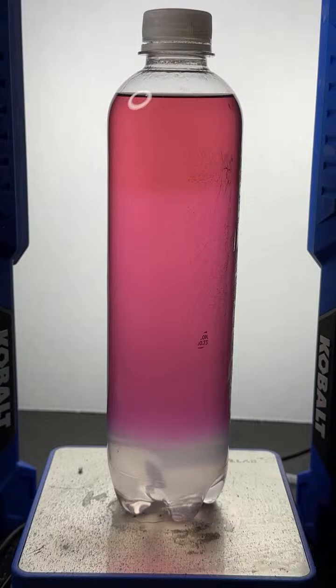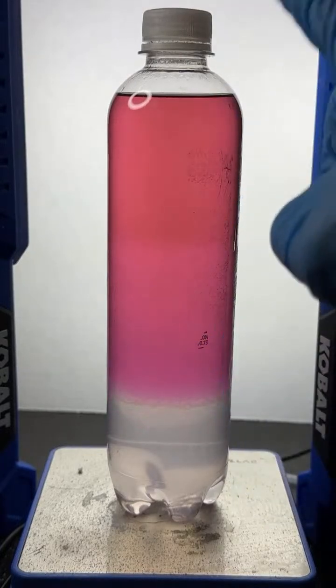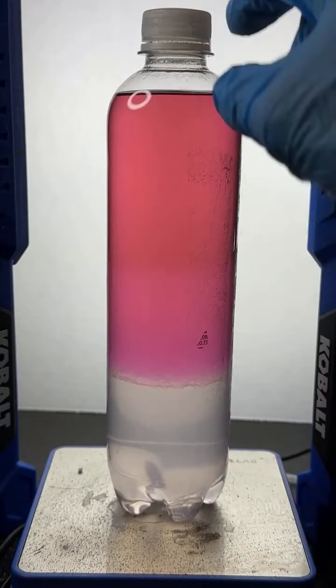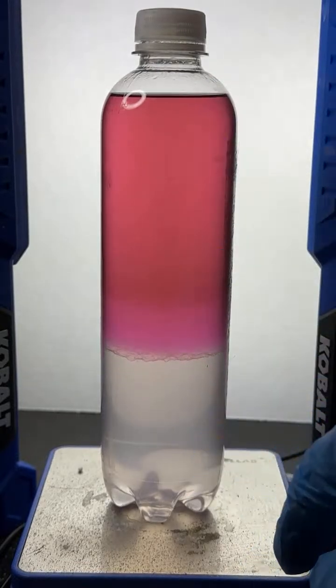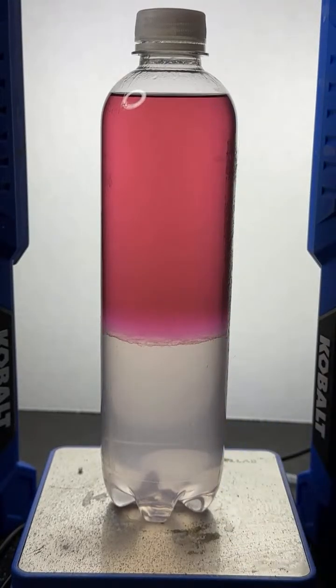Hey, thanks there, Nick. So, Nick, just to give you an idea of what we're doing, this is just a bottle that contains salt water. It's actually a special type of salt called sodium carbonate, and alcohol. And then I'm adding some different dyes to it and seeing if the dyes go in the alcohol layer or the saltwater layer. You also see a third layer here that's a transient mixture of the two. We call that an emulsion.